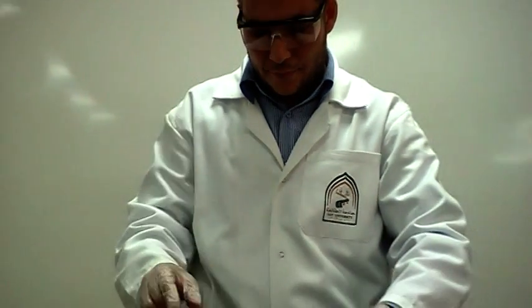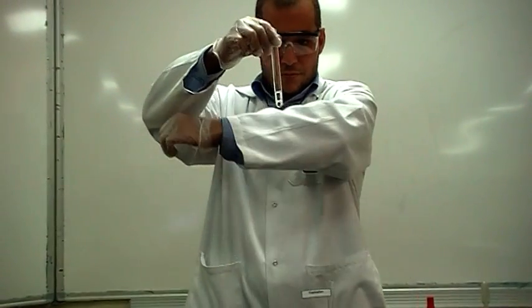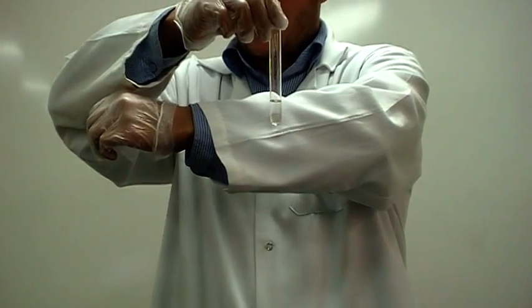Let's see the other one, which is the control. You see? There's no ring. That means we don't have tryptophan.